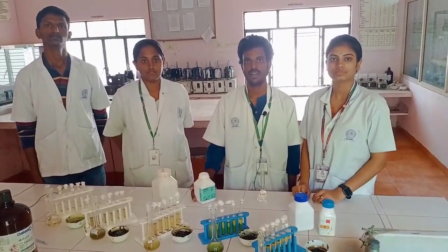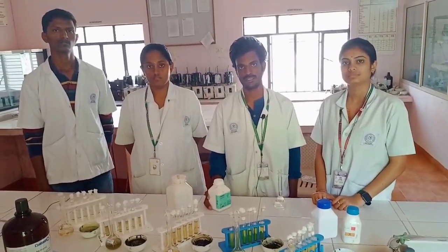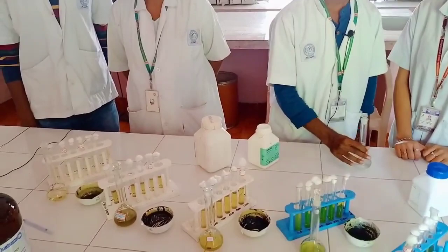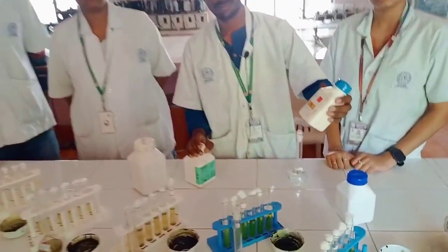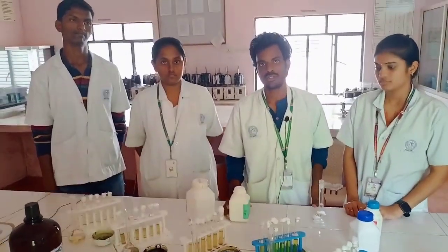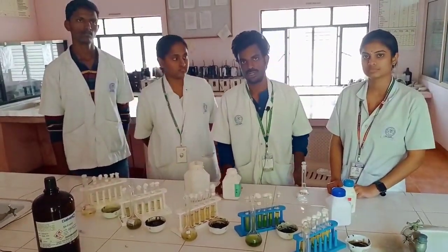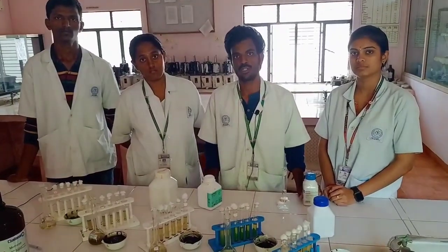I am Veeresh. I am explaining about the calcium oxalate depletion assay. For this, we have to prepare a calcium oxalate slurry. We maintained pH 5.7 by adding sodium acetate. We also prepared tris buffer and added calcium chloride and sodium oxalate. With this solution, we added the extract to a flask. After keeping it aside for 10 minutes, we measure the UV absorbance. Then keep aside for another 10 minutes before proceeding to UV instrumentation.